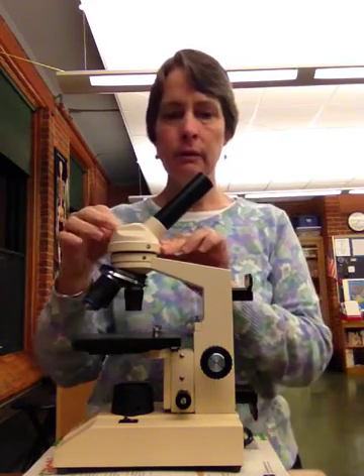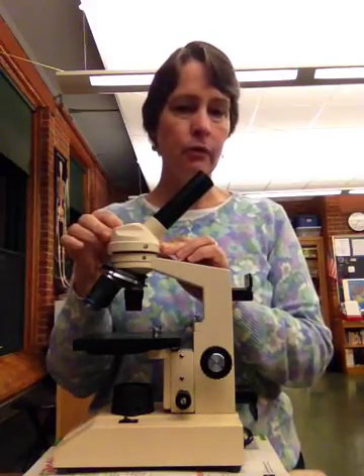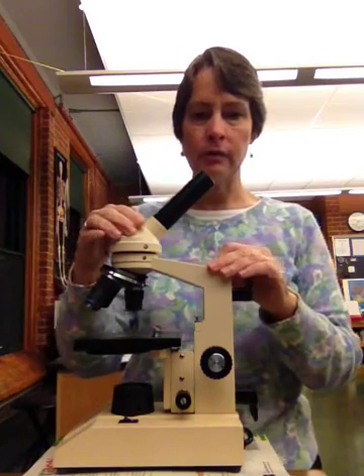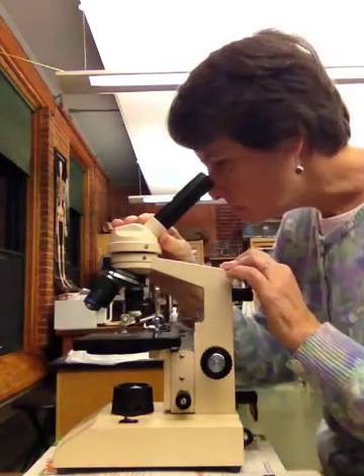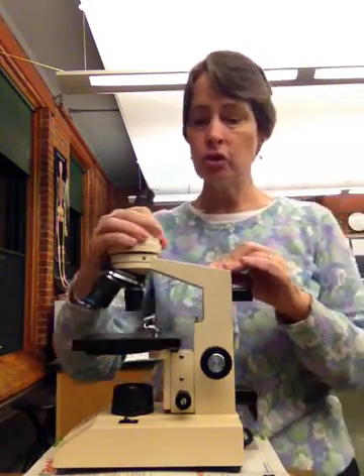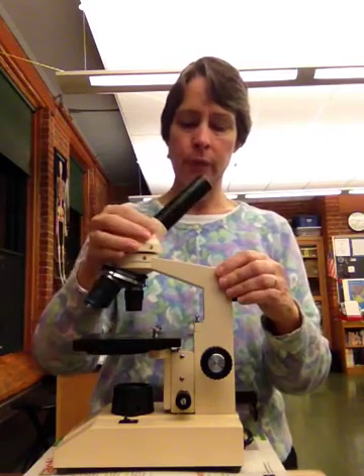And then we come down here, you have the head of the microscope. This one is more rounded. We have some other microscopes that are more square, which is pretty neat. The cool thing about this is it moves. So if I'm looking at something through the microscope and I want my partner to look at something, we can just turn this and I can look at it right here, and I don't have to be moving my microscope around. That's a pretty neat thing.